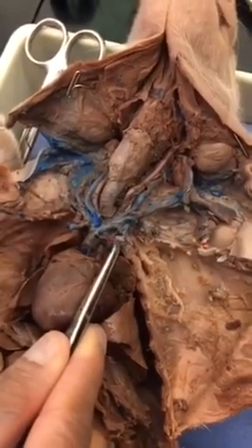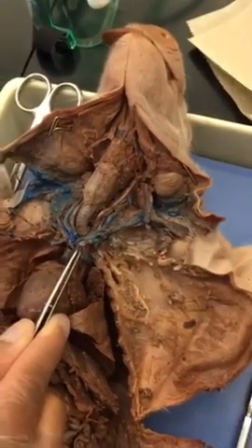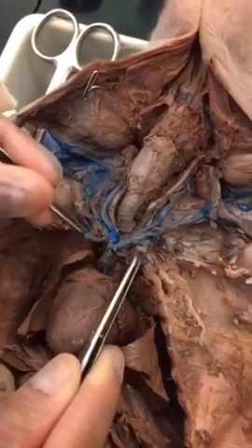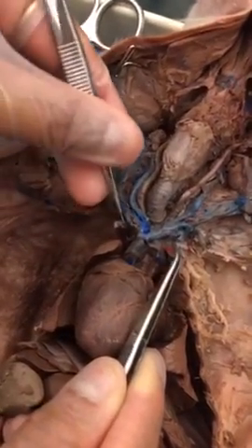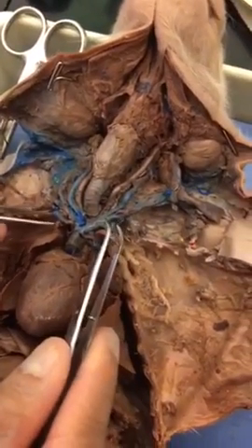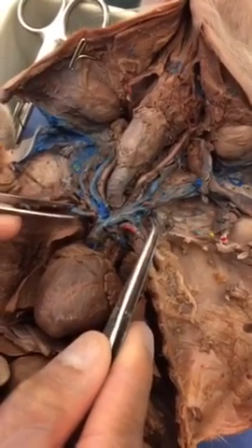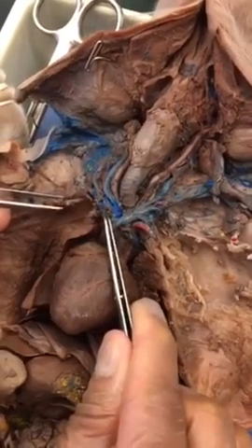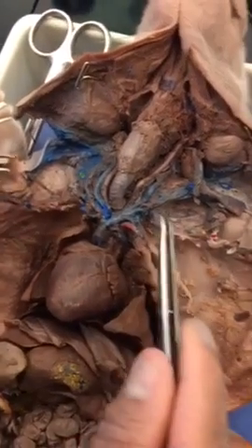Left and right, the fatter ones. Left and right subclavian veins. The left one is all mushy, so Professor said it's fine if we just show him the right, the fatter one, that is cut, thanks to me.